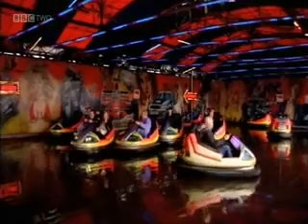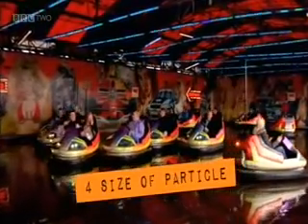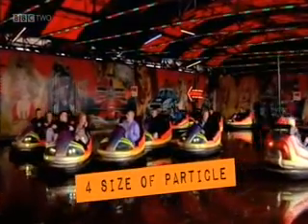It's actually gotten so hot that it's boiling, and you can see a plume of water vapour which accompanies the oxygen as it comes out. The catalyst is causing the breakdown of hydrogen peroxide into water and oxygen at a phenomenal rate. But the catalyst has not changed at all throughout this reaction — the catalyst is still there. We could filter it away and collect all of that black stuff — that's our catalyst. And finally, the size of particles.